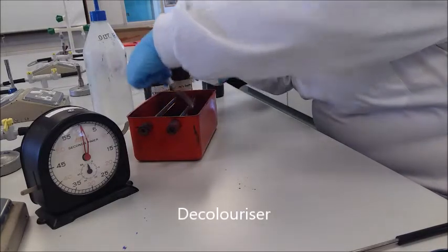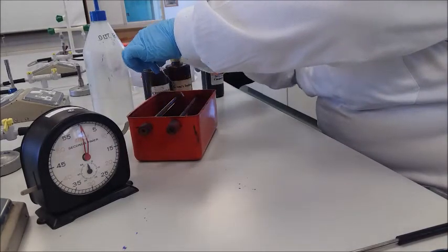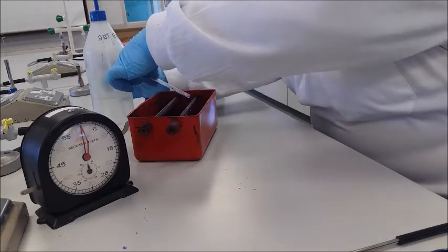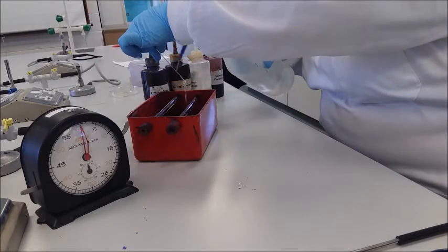Then rinse with decolorizer until it runs clear. Be careful not to leave this on too long because it breaks down the cell wall. Rinse immediately with distilled water.